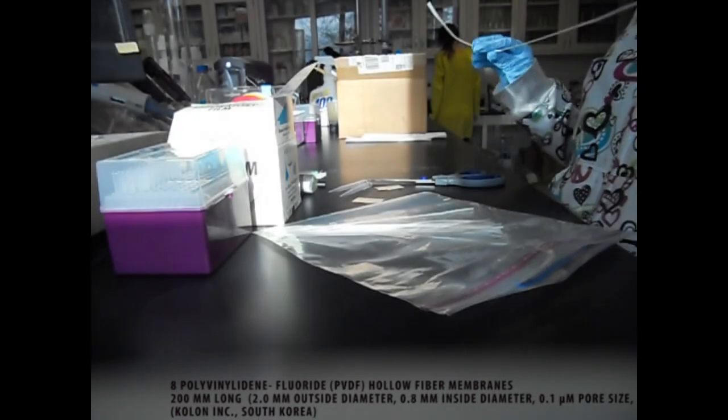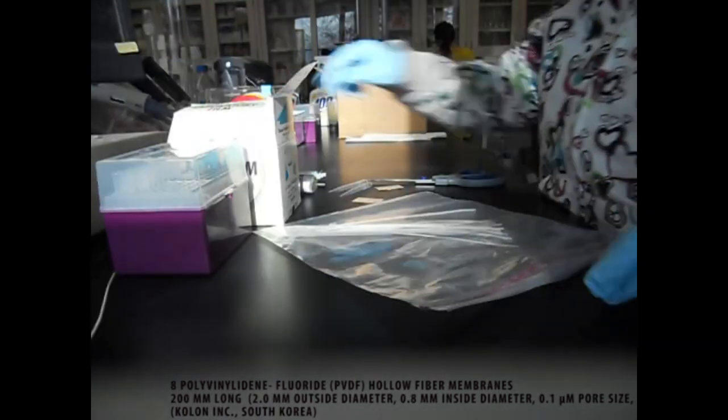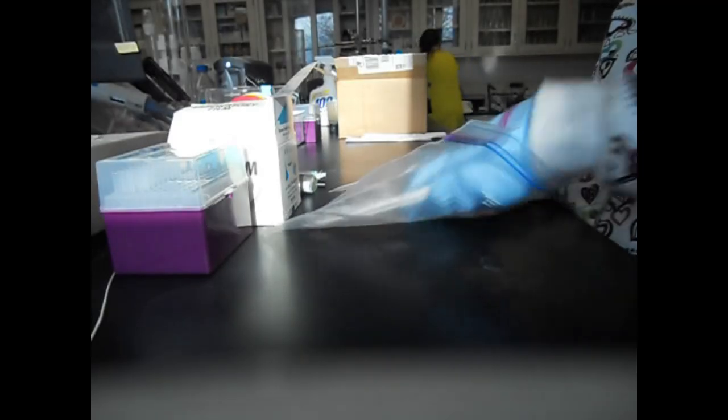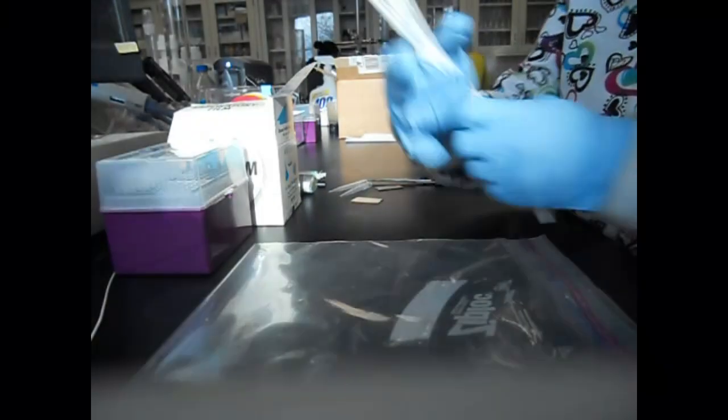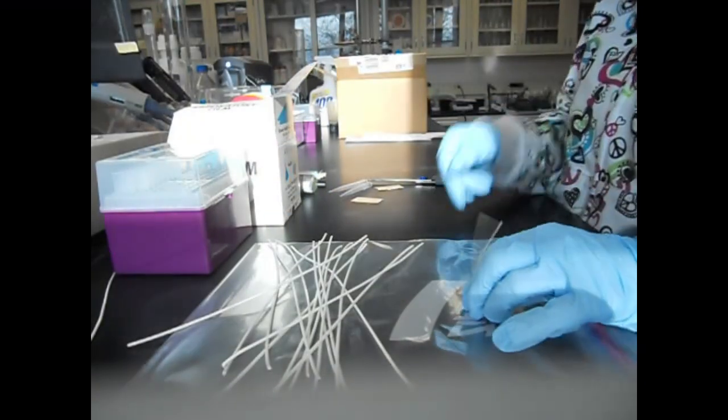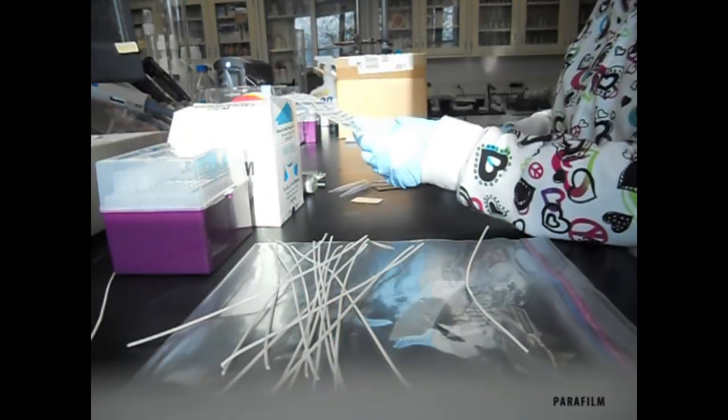First, we have already cut these long membranes to the shorter ones, just to determine the length that you need. And then we need some of these parafilms.